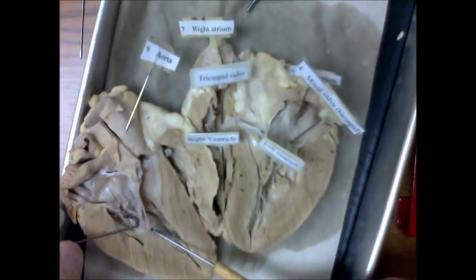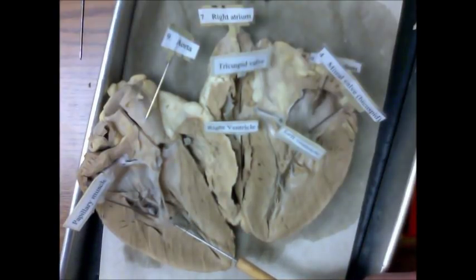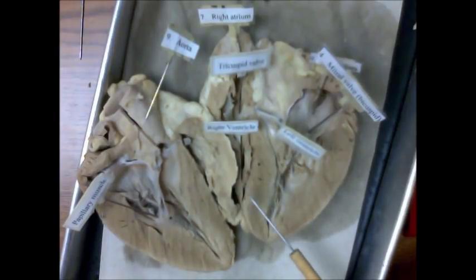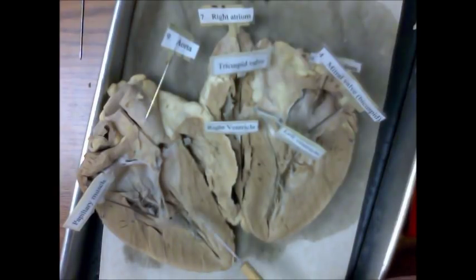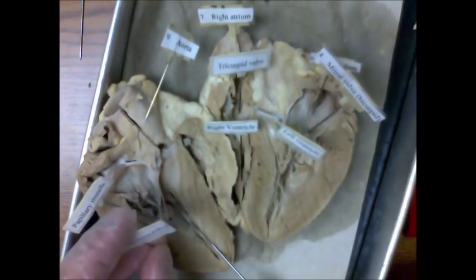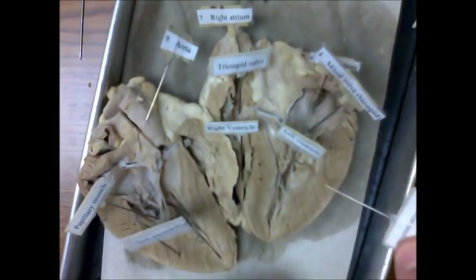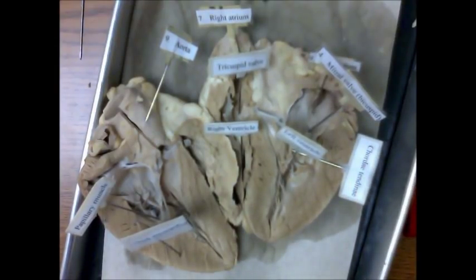Attached to the heart strings are what are called papillary muscles. Here we can see thick myocardium surrounding the left ventricle — it is also present on the other half because this heart has been cut in two and opened like a book. Heart strings are known as chordae tendineae and are always attached to atrioventricular valves.